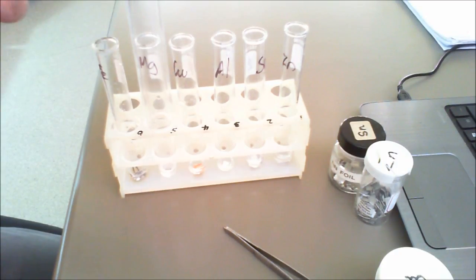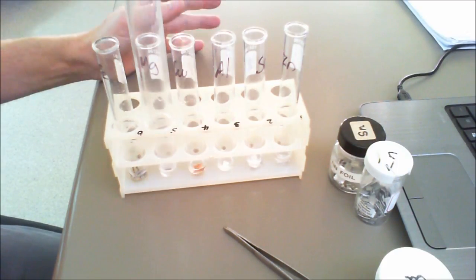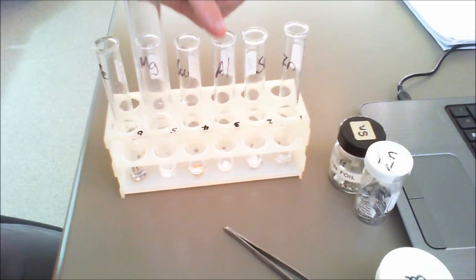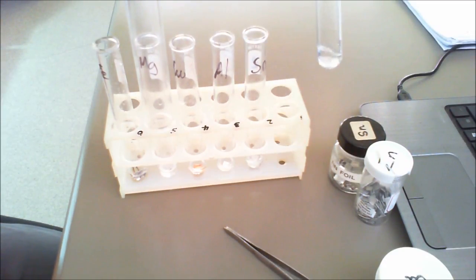Our magnesium here, which is this one, has bubbled furiously. We've got nothing, nothing, and nothing, and then we've got some zinc starting to bubble there as well as the coating starts to wear off.